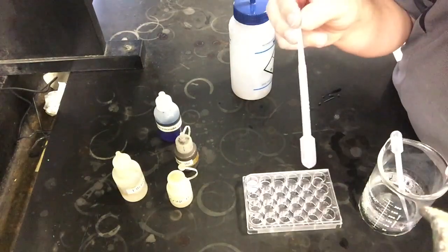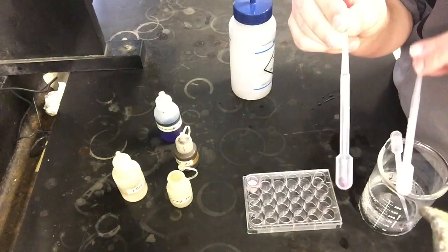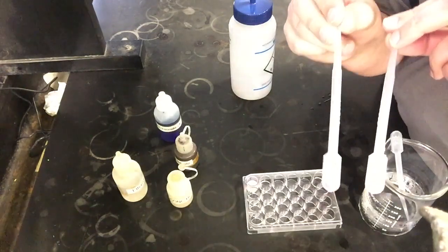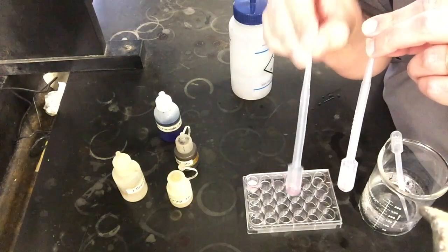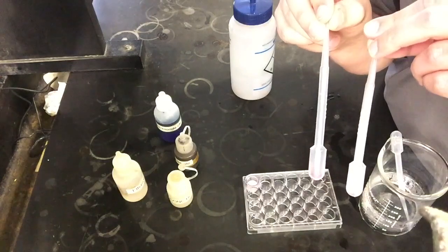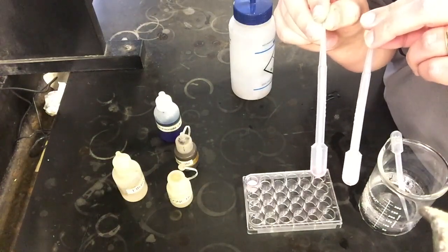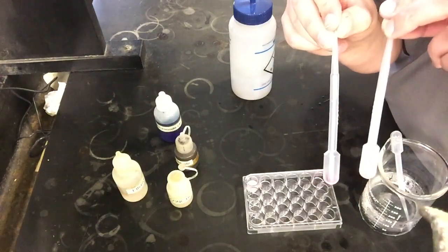All right, so here what I have is our solution that was in the hot bath. Here's what I just took out of the ice bath right here. And these two colors are very similar. Might even be hard to differentiate them too much. But this one that just came out of the hot water is very clearly a good bit darker. It's not blue by any means, but it is more of a darker tinge of almost purplish pink, as opposed to the really light pink one that came out of the cold water bath.